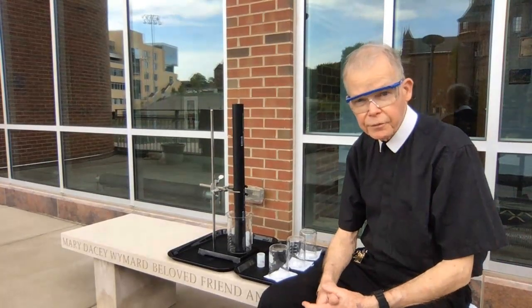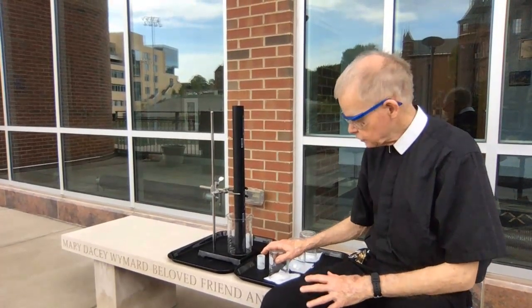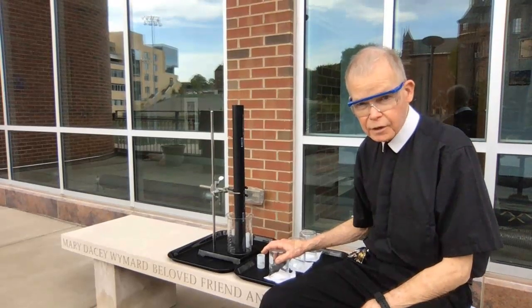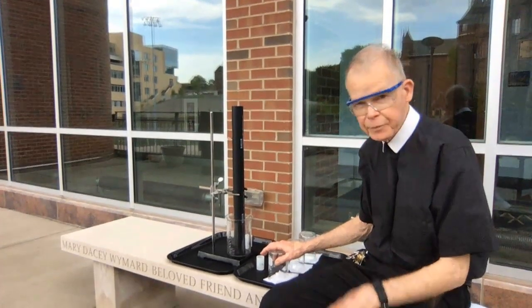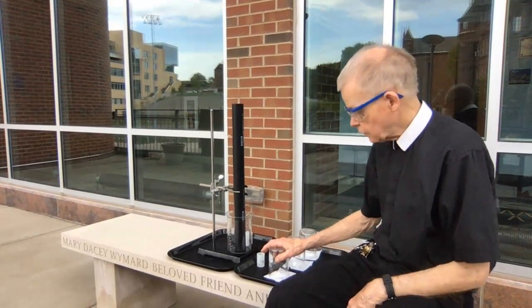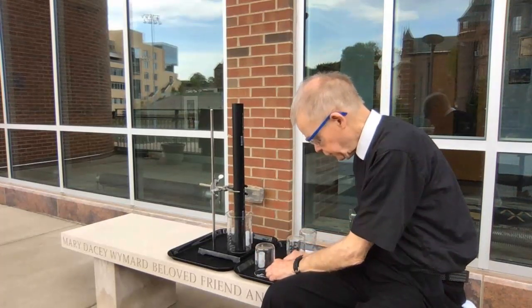Well, we're all set to go with our reaction. What I've done is I've put the baking soda on the paper, but I've covered each paper with a beaker because it's been windy out here, and I knew that if I tried to do this without a cover on the sodium bicarbonate, it would all be blown away. And that has happened in the past. There are occasionally times when I've done this experiment where the students get everything measured, a gust of wind comes on and blows it off. So let me take my first sample here and we'll wrap it up in the paper.